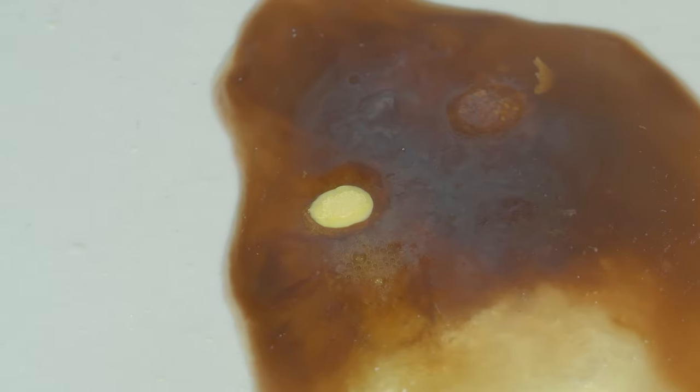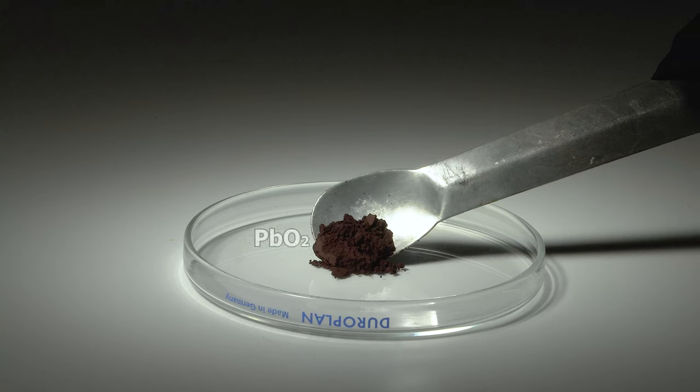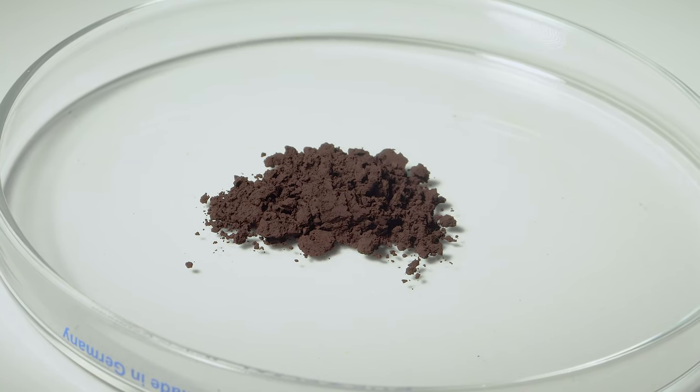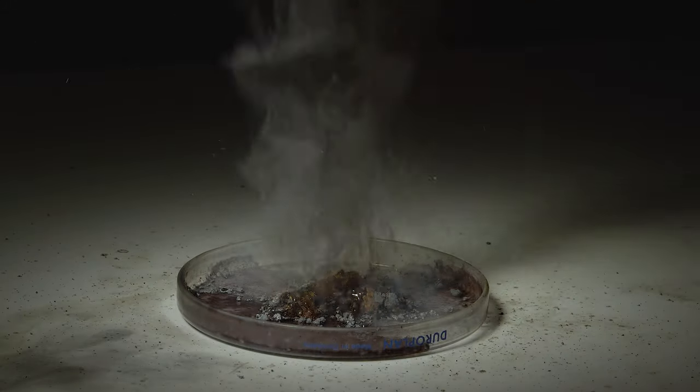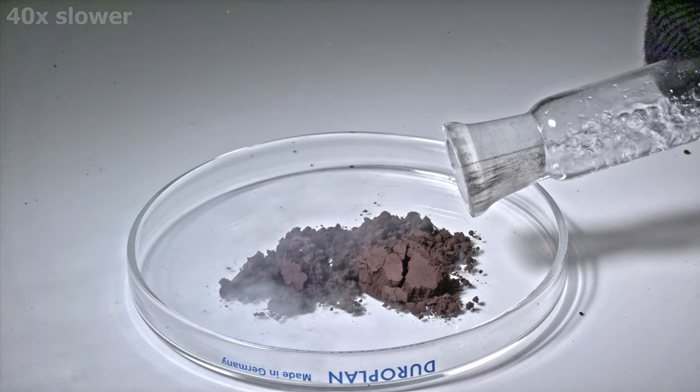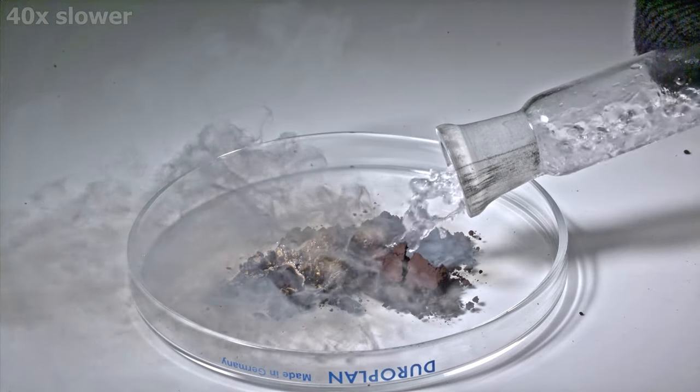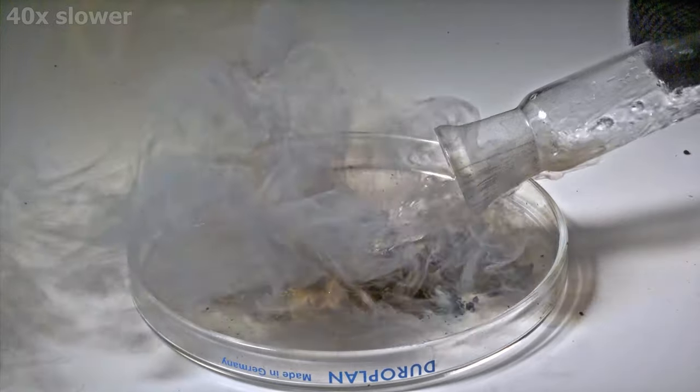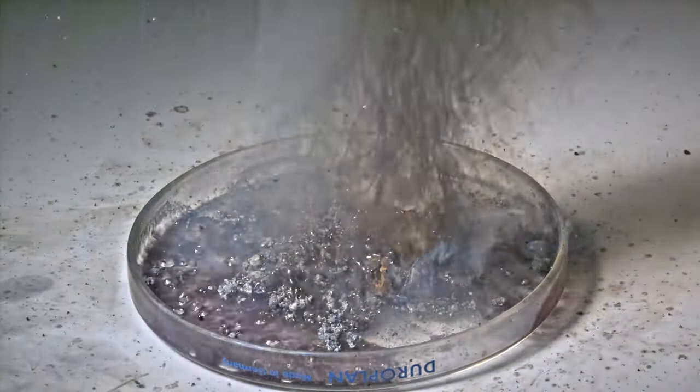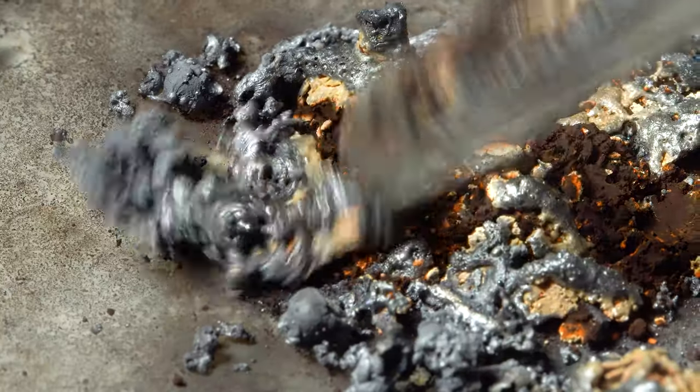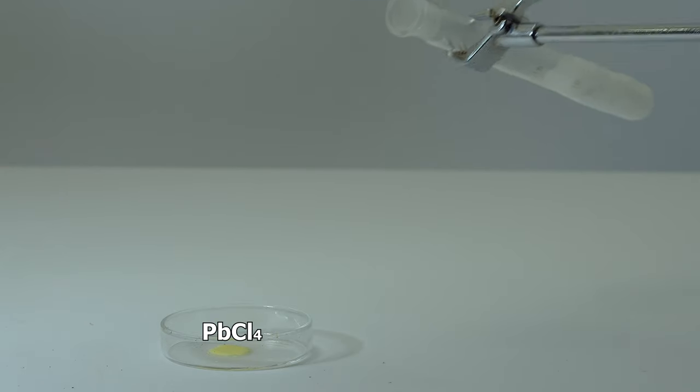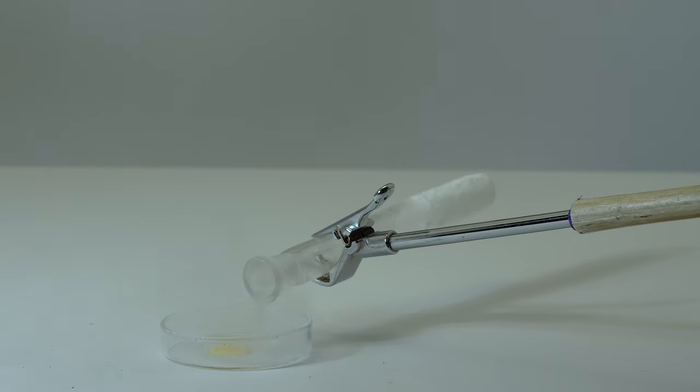Lead dioxide is a strong oxidizer. Hydrogen sulfide combusts in contact with it. To make the demonstration of this reaction as visual as possible, I'll pour liquid hydrogen sulfide out on lead dioxide.